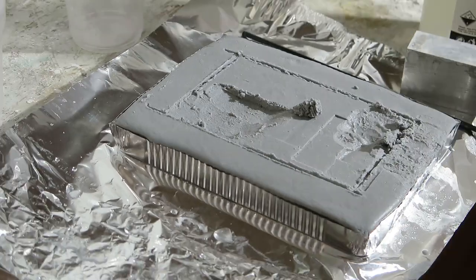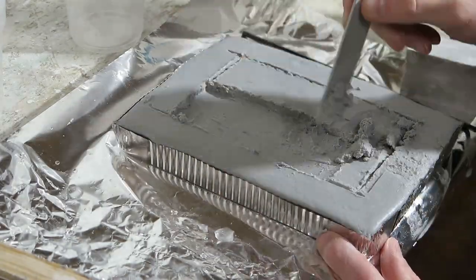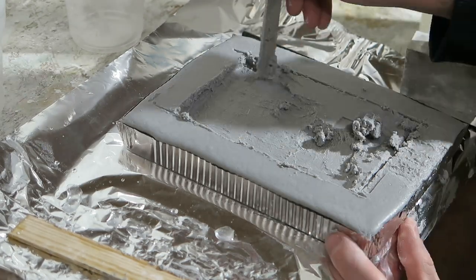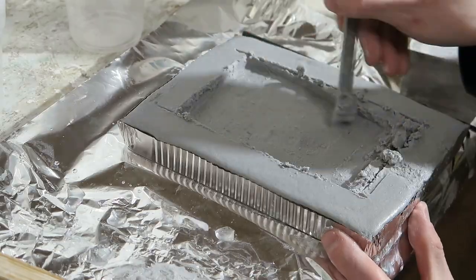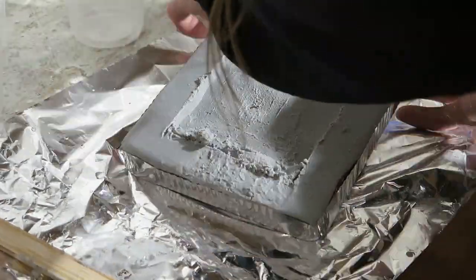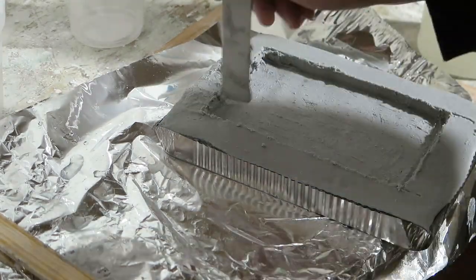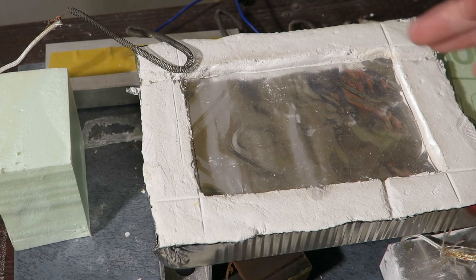I am using this cheap disposable aluminium trays for baking stuff. I was pretty much still at testing phase at this point. You can either form some features on it while it's wet or you can carve it when it's set. I have decided to go for carving this time but I have experimented with overmoulding glass fibre cloth and it works very well. I am not using any special tools for carving this time but I have done also some carving with tool that has set depth and it works well too.